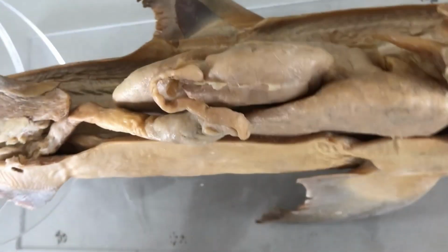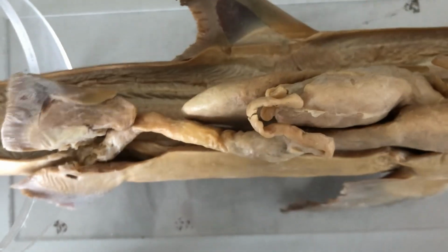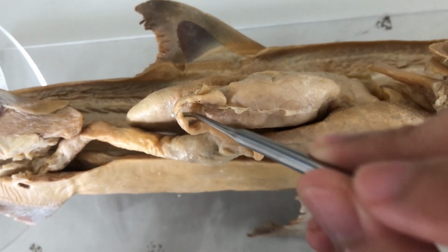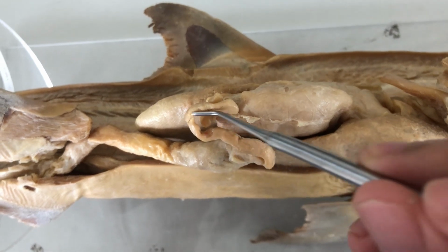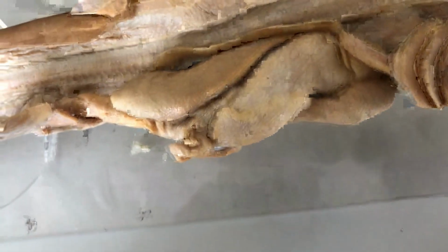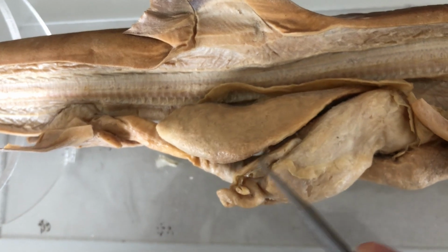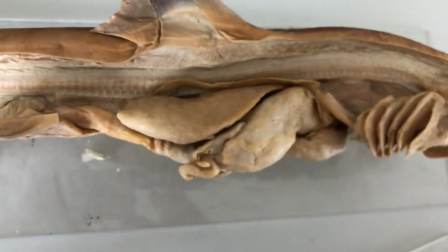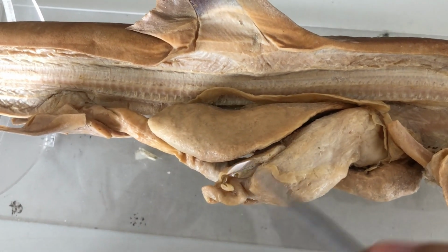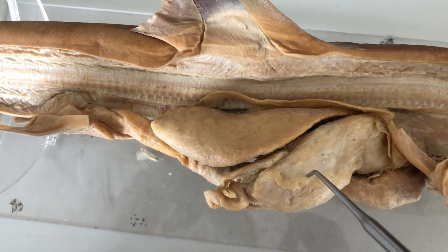What about here? So this is the stomach or esophagus stomach, and it's continuous with this. So this must be the duodenum. It's already broken. Okay, duodenum leading to the valvular intestine. But there's a tube-like structure again beside the duodenum. It's actually part of the pancreas. Okay. In our plastinated specimens, their textures look very similar, so be careful. That's the pancreas. This is the duodenum. The duodenum must connect to the stomach, of course.